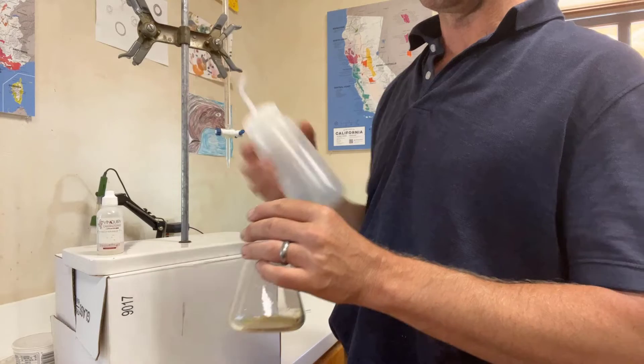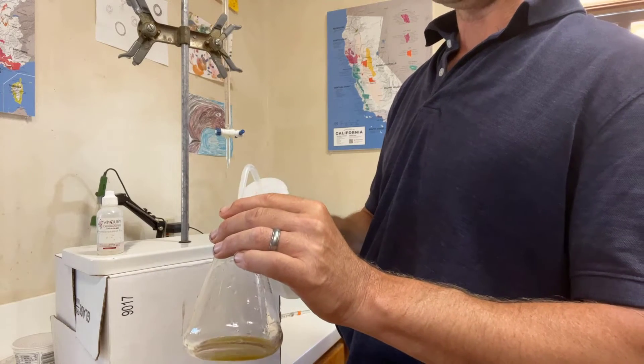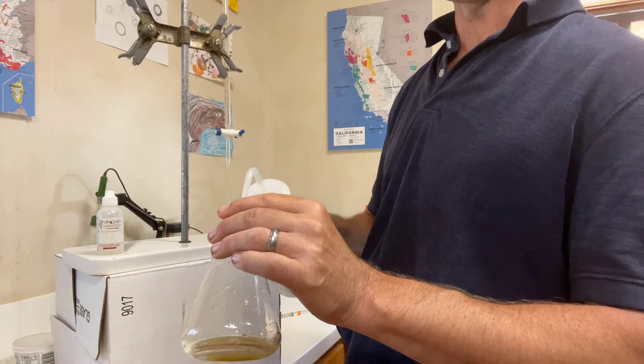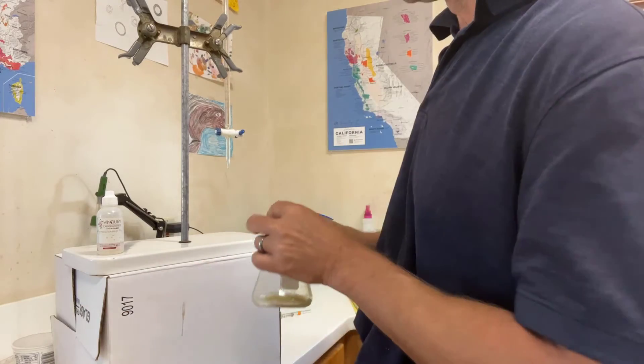Then I'm going to add some water, again deionized, just to increase the volume of the sample here. It makes it easier to do this whole operation.